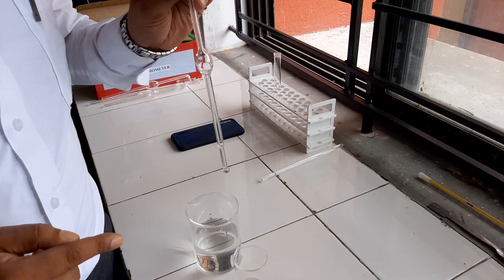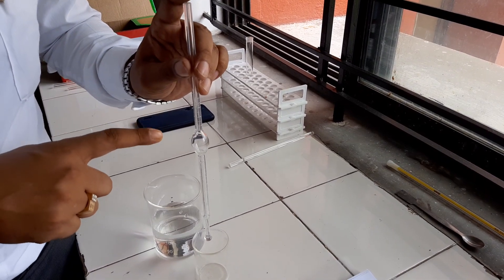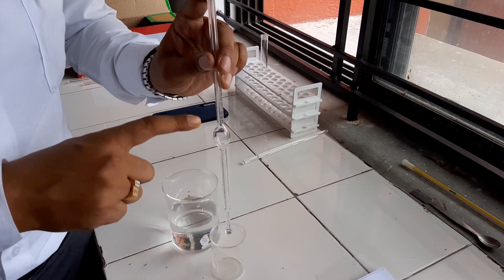After that, start counting the number of drops. If you do not count, no problem. Just you have to take the liquid from here to here, upper to lower mark.